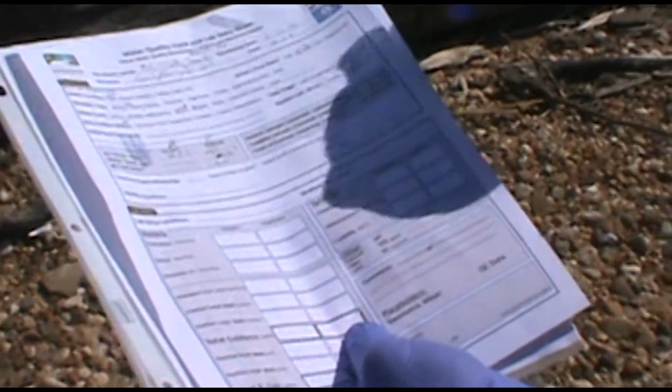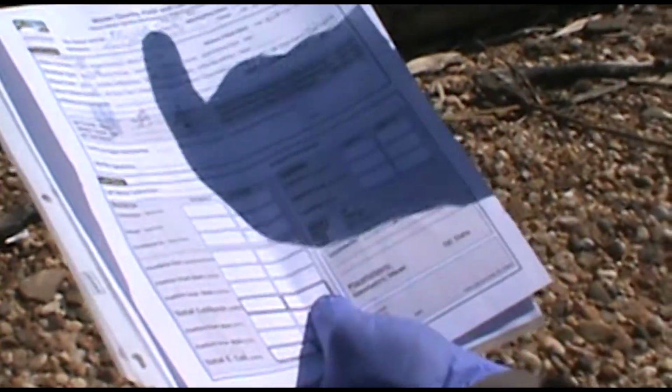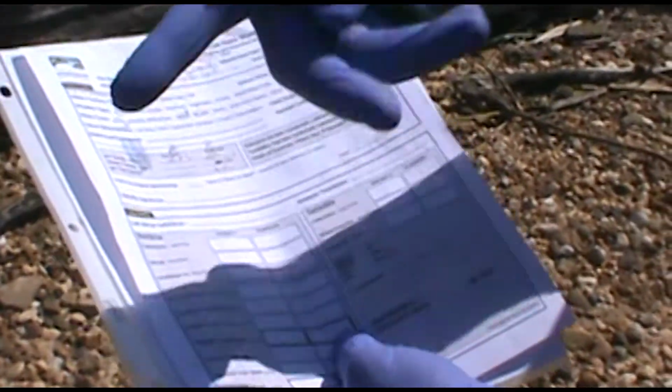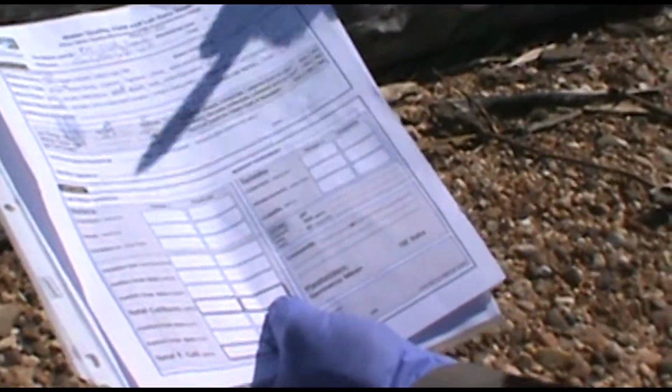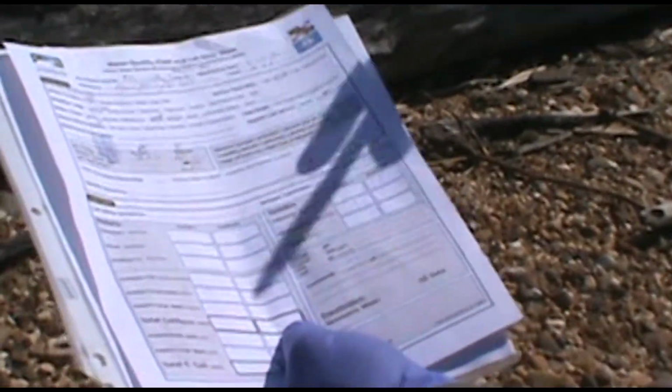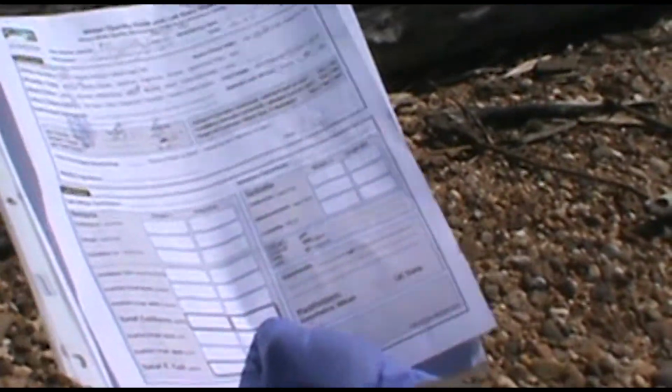A and B. A is going to be at the dock, B is going to be here, so for today at least, we're going to do Mallows Bay on one sheet, but use the 2 columns. We're going to use the duplicate fields that we normally have, but we'll give you 2 sheets if you want to do 2 sheets when you come out here each time.